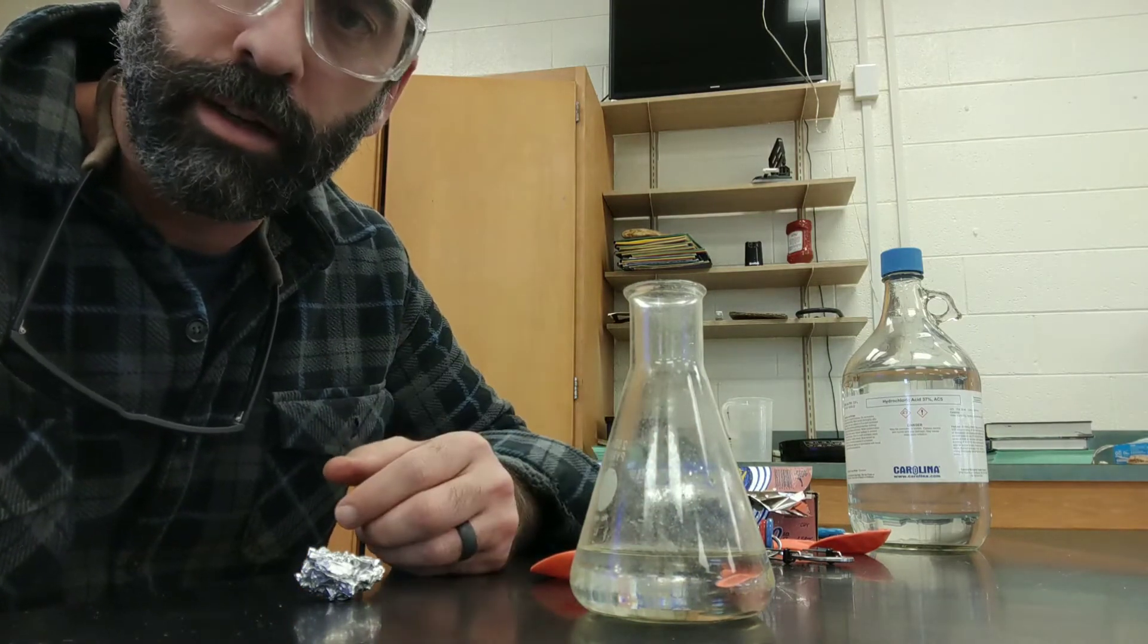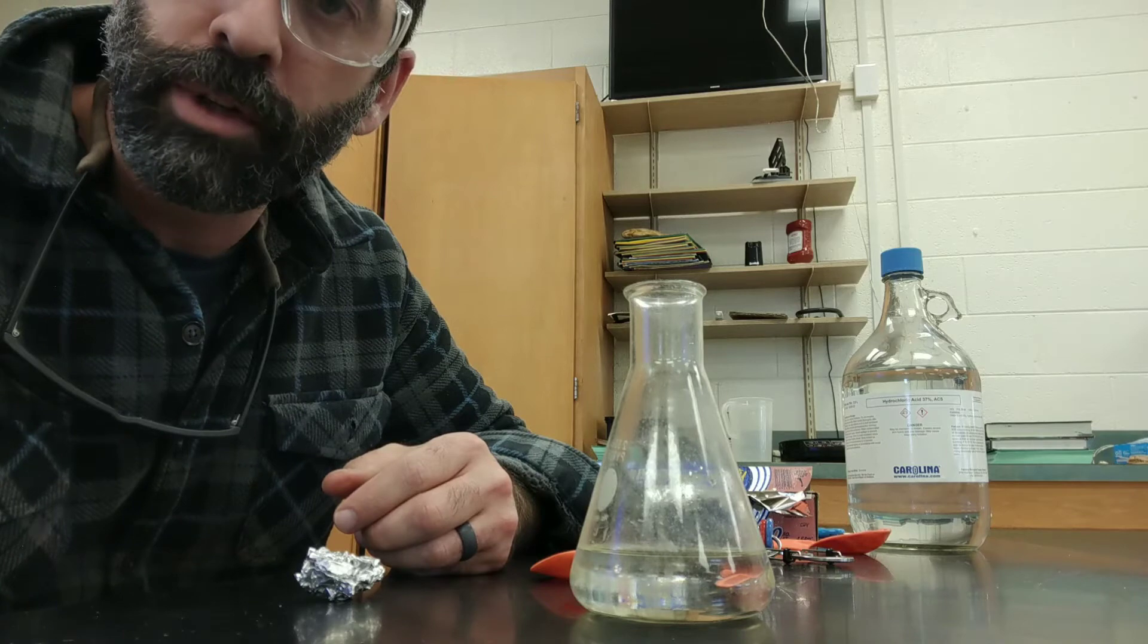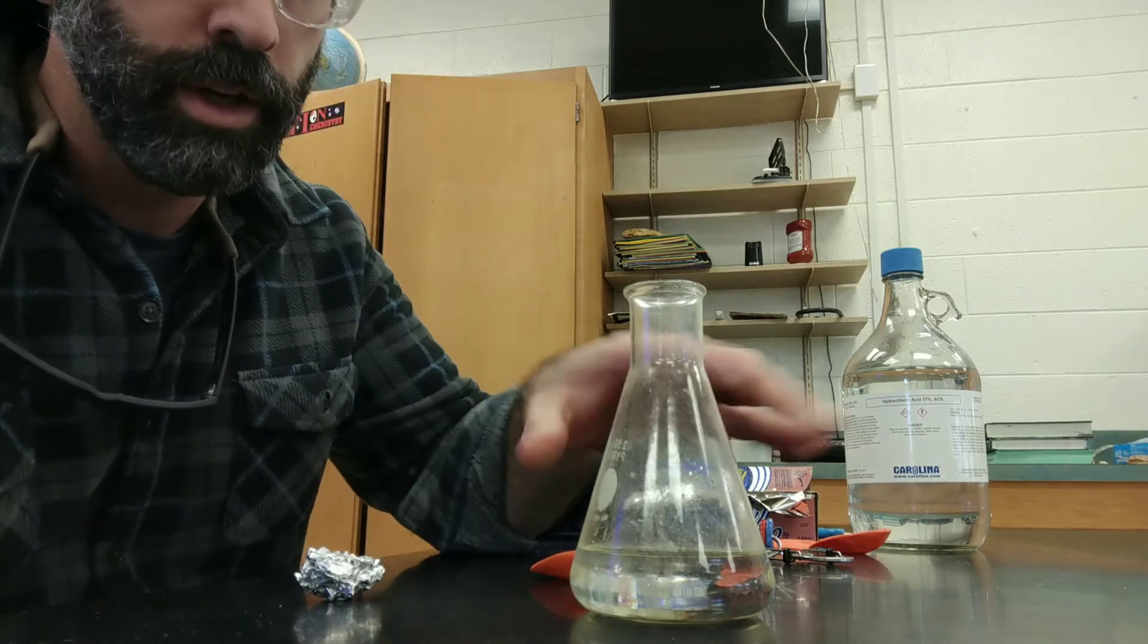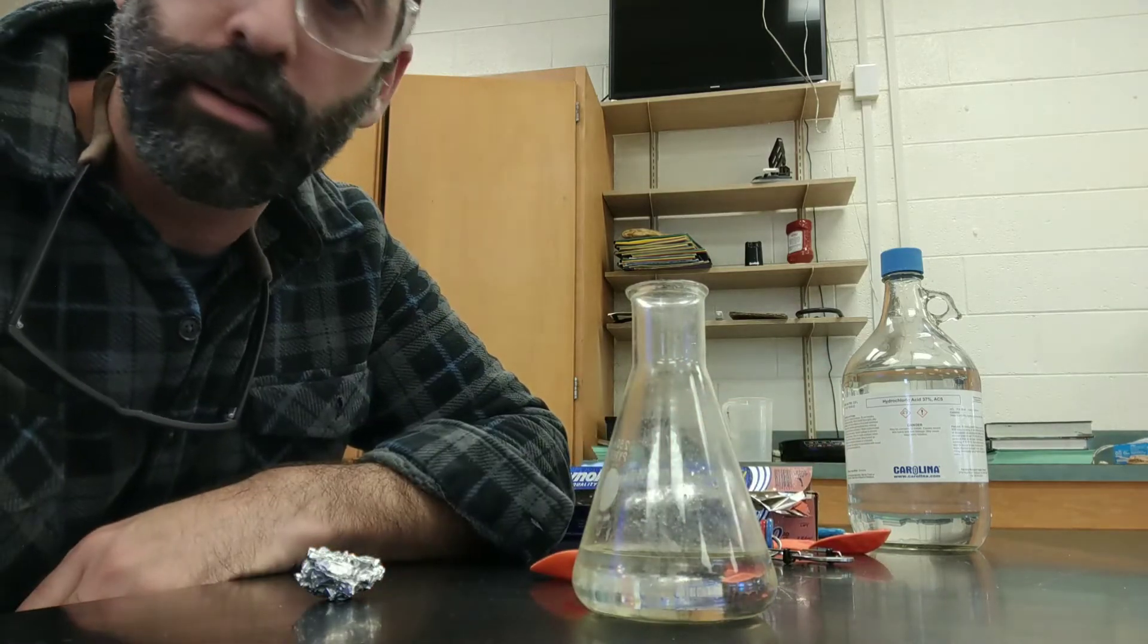The reaction will take a little bit of time, about 45 seconds to really get going. It is exothermic, so it will heat up the flask quite a bit.